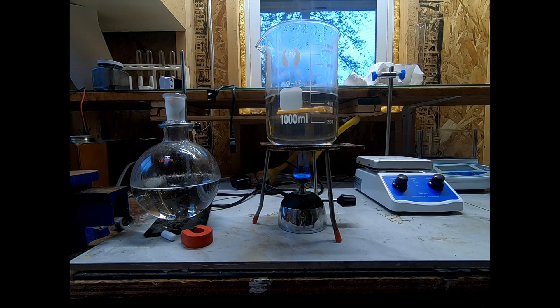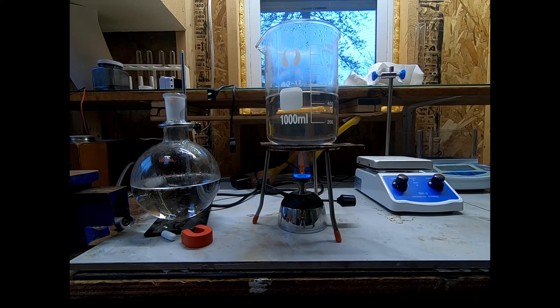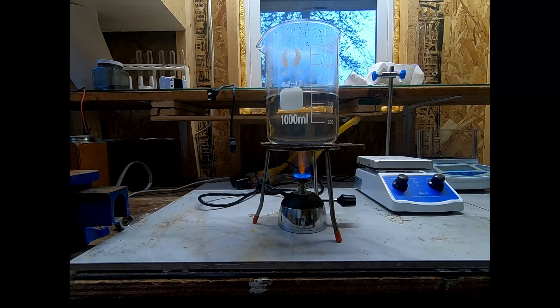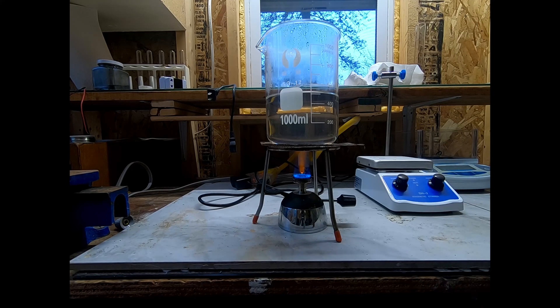At this point I realized my mistake, so I decided to boil off more water until I saw some crystals appear. I heated it more aggressively with my burner to reduce the amount of water present in the solution and try to precipitate some crystals.